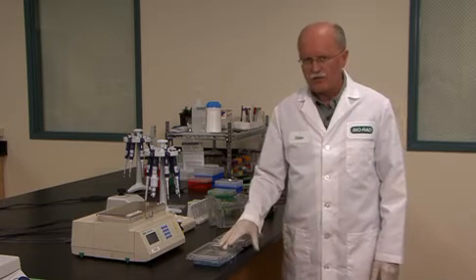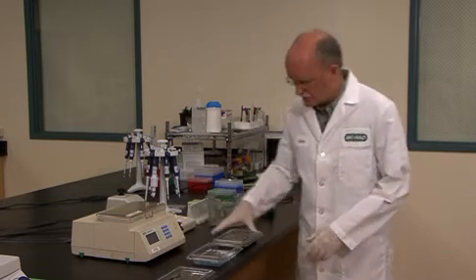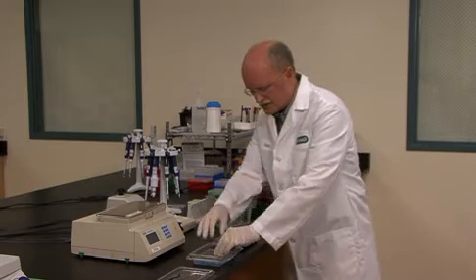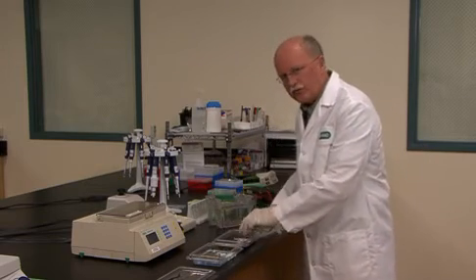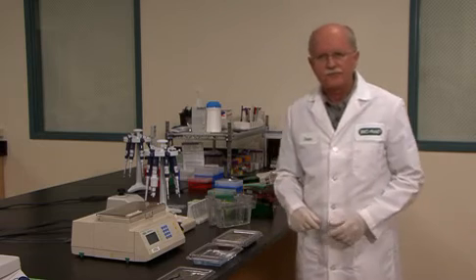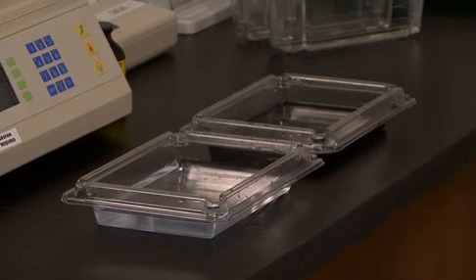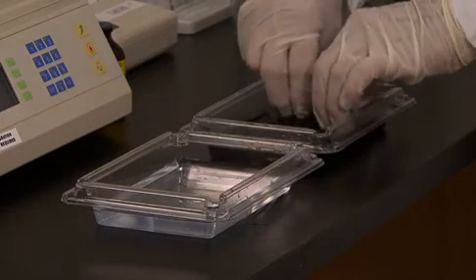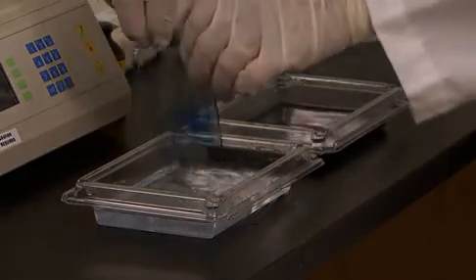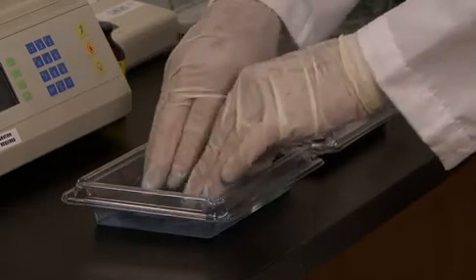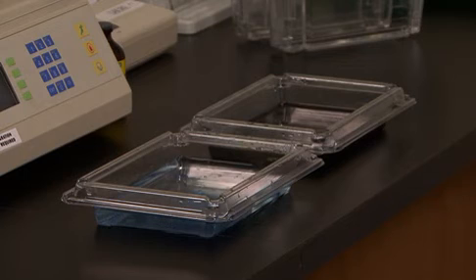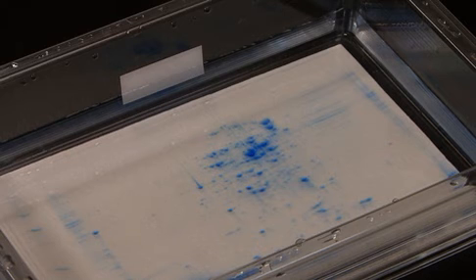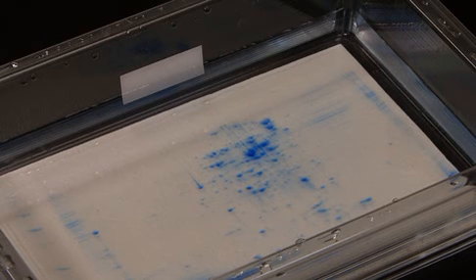We are now going to stain the gel using Bio-Rad's Bio-Safe Coomassie stain. Following the 3 ten-minute water washes, we are going to transfer the gel to a tray of Bio-Safe Coomassie and stain the gel for 45 minutes to 1 hour. Following staining, we are going to transfer the gel from Bio-Safe Coomassie back into water and destain until you get desired background. At that point, the gel will be ready for imaging. Here you can see that I have generated a gel with a clear background and well-resolved spots.